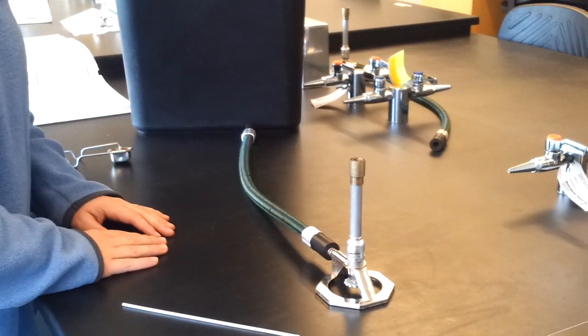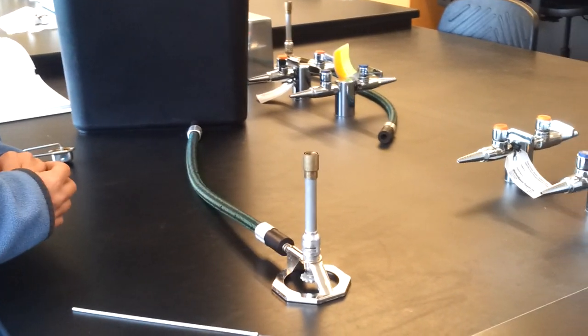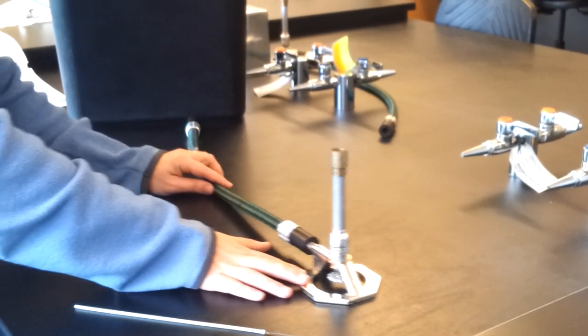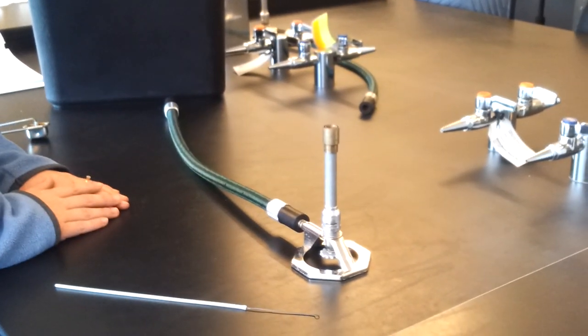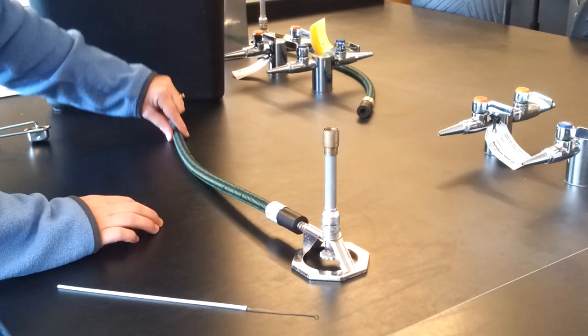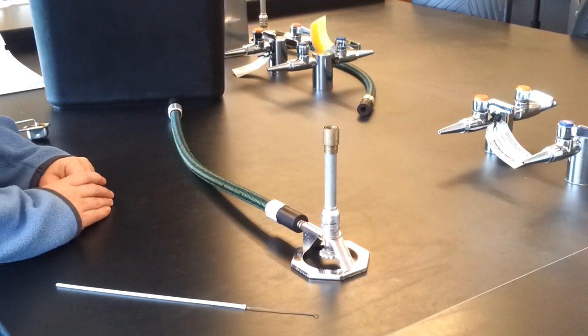Okay, so this first video is showing you how to adjust your Bunsen burner. Each lab bench will have a Bunsen burner for two people to share, and it has this nice insulated tubing for the gas.